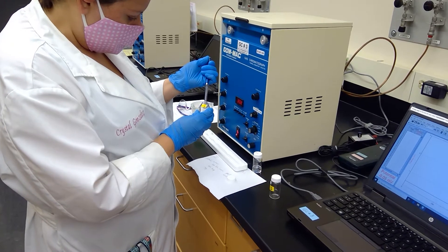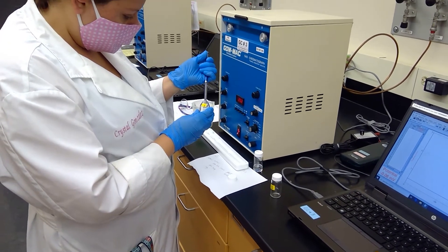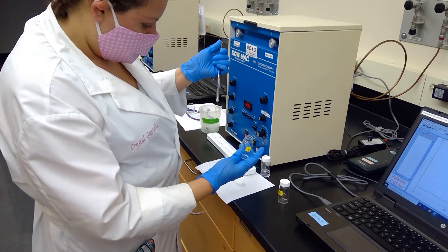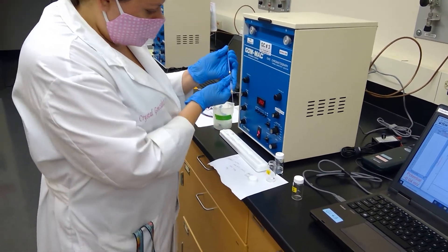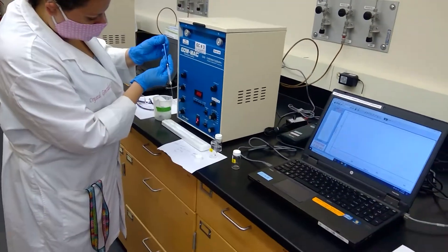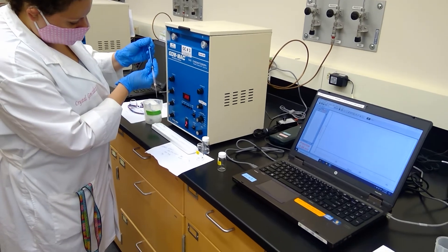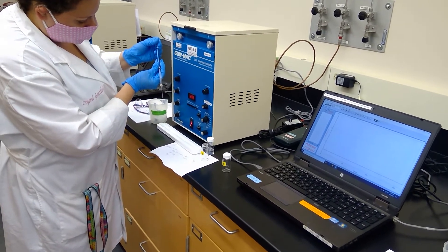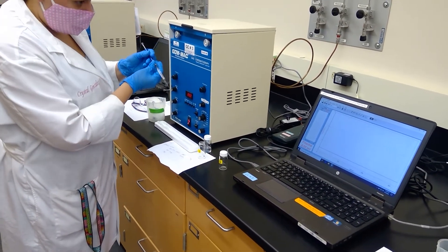And now I'm going to measure two microliters of sample into my barrel. And I'm going to place down my vial. And I'm going to go ahead and pull back on my plunger here and add some air. So I'm going to go all the way to four microliters, actually five microliters with air.